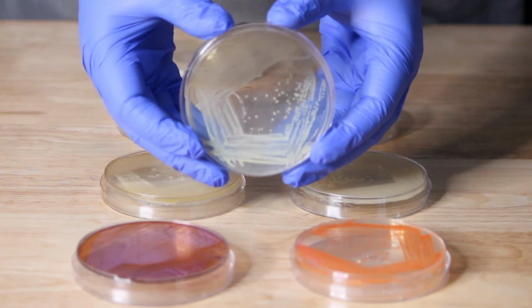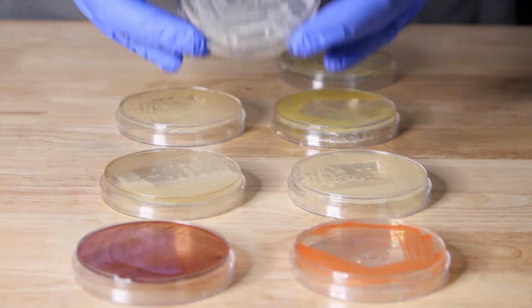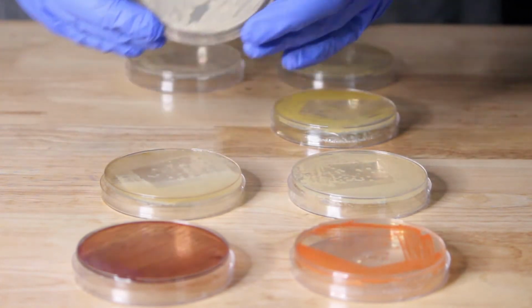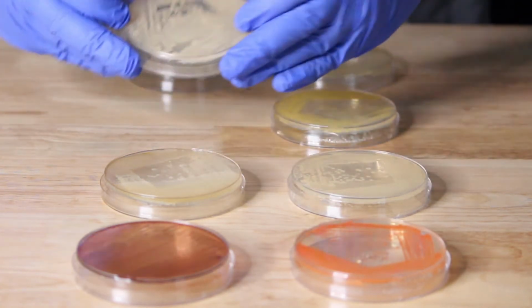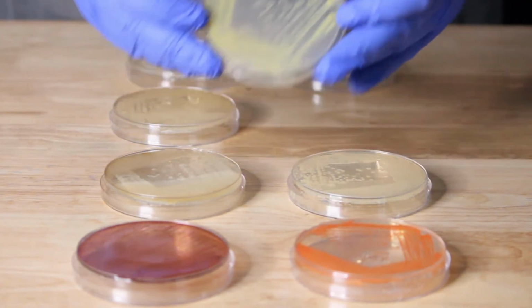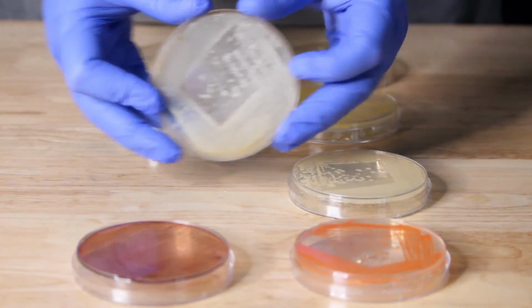Here are a few different types of media that I have used to inoculate bacteria. These are old plates that have overgrown, but you can still see the growth of bacteria on the plates. Media is great for determining types of bacterial infections in clinical settings and is still used today in medical laboratories.